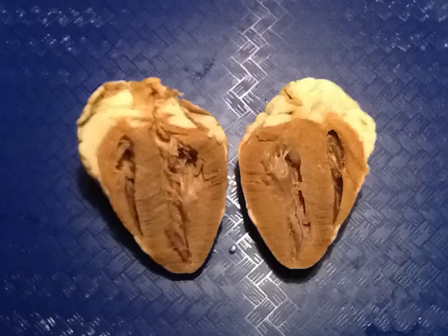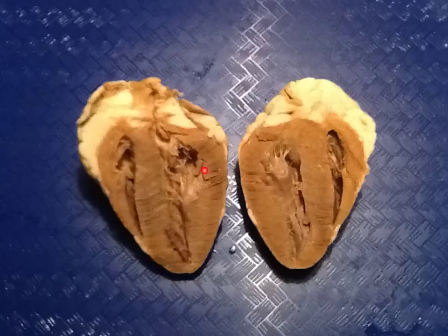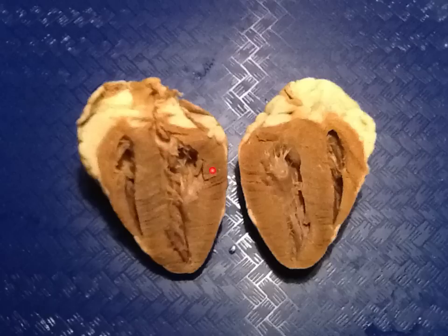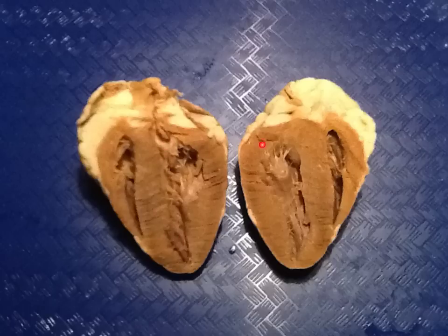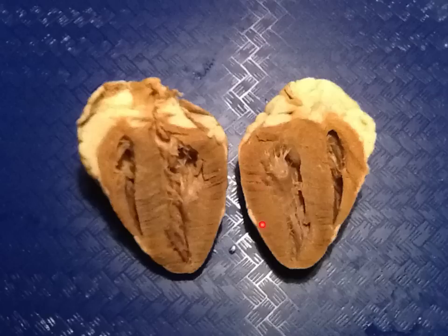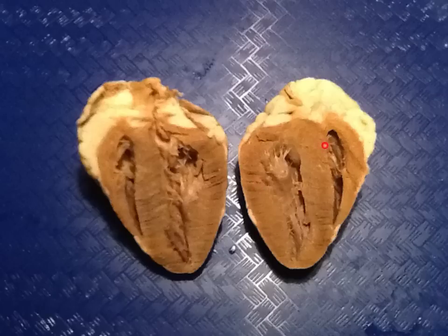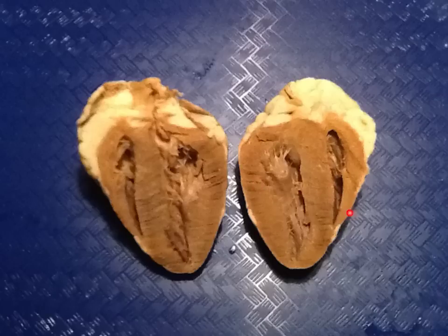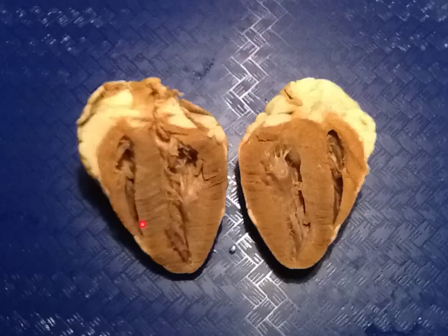The left side of the heart always has a thicker wall. Therefore, this is the left side of the heart, and over here we see the right side.